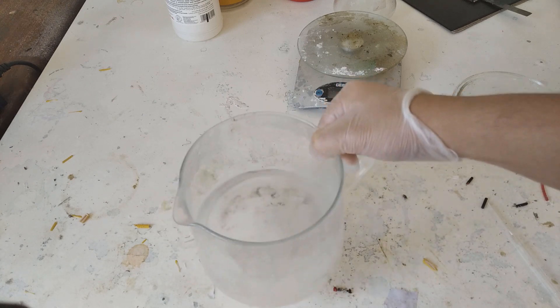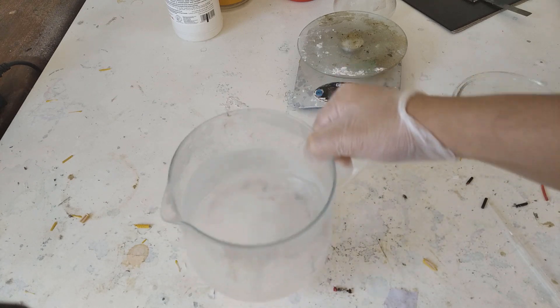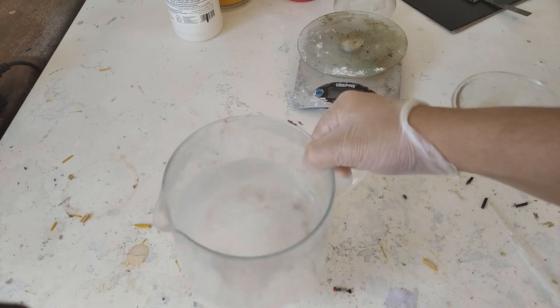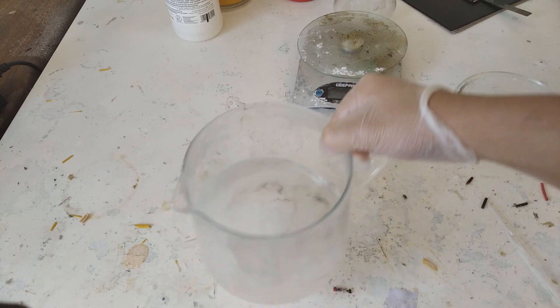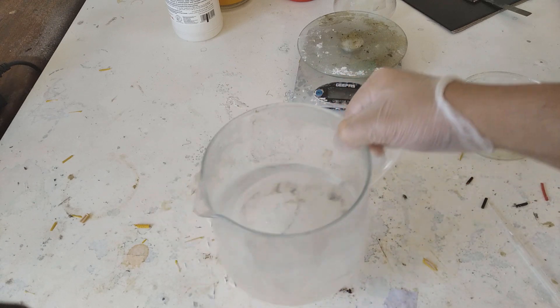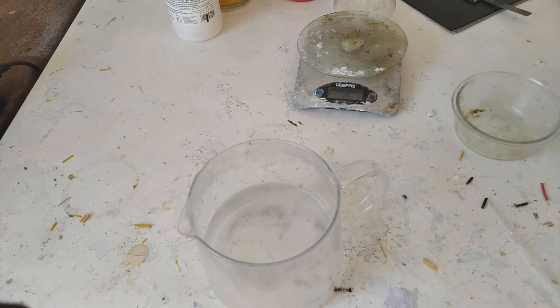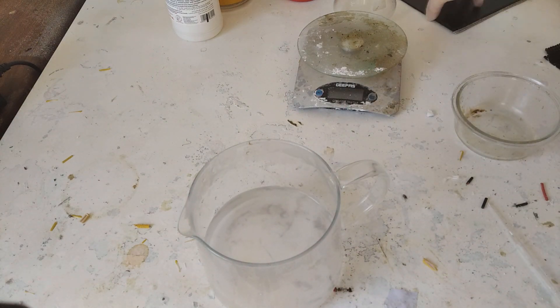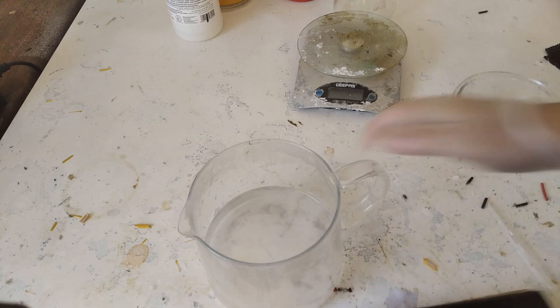And as you can see it's literally starting to cloud already but all our citric acid is not dissolved. We still have some at the bottom. Now it's fully dissolved. You can see it's becoming cloudy. Let me put on the black background in order for you to see it better.